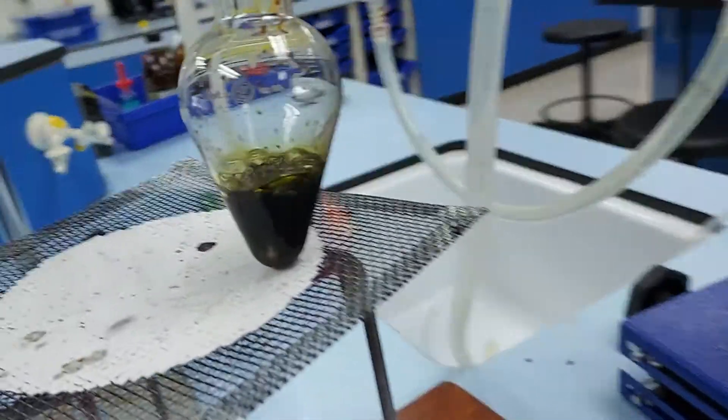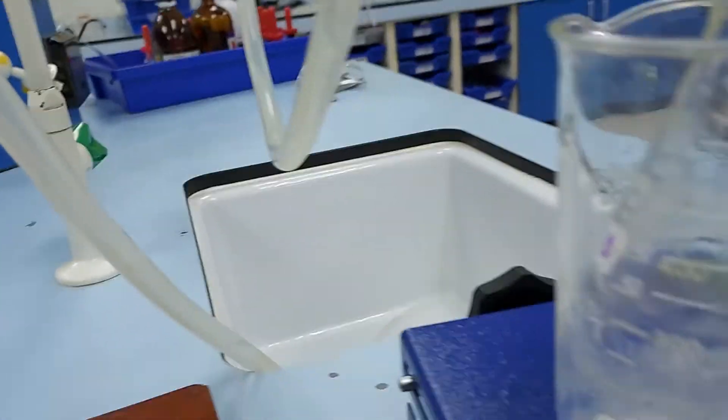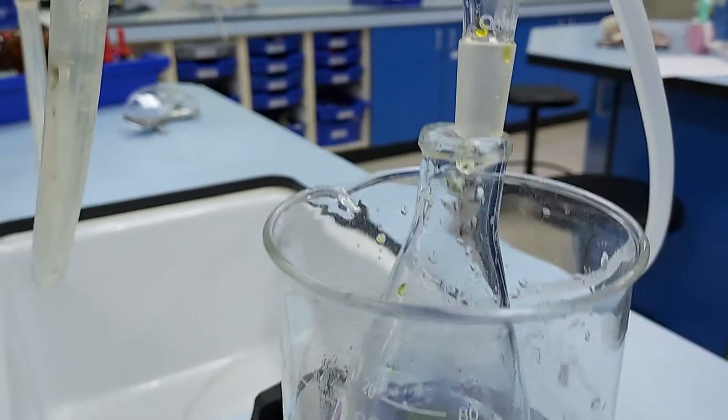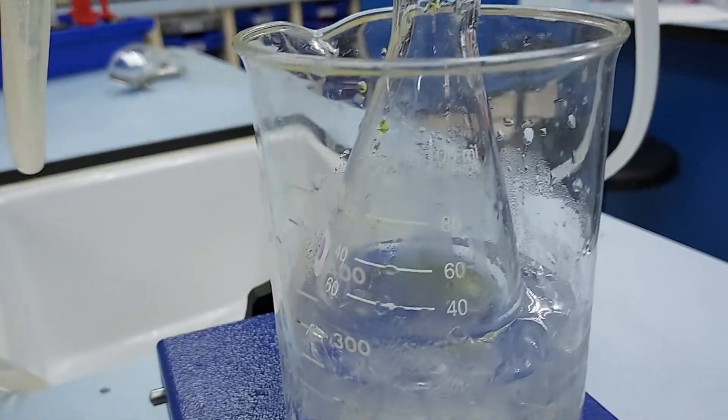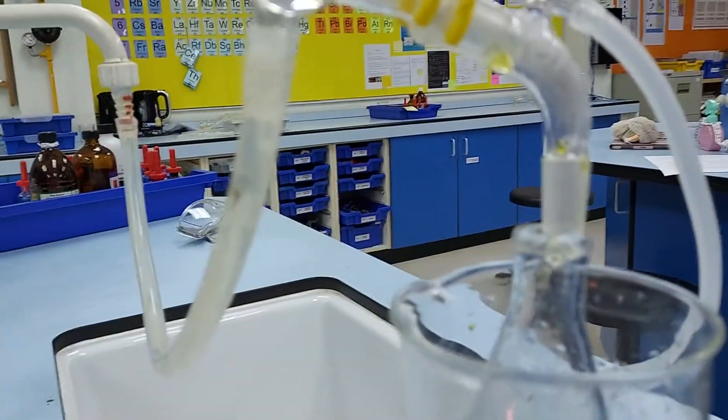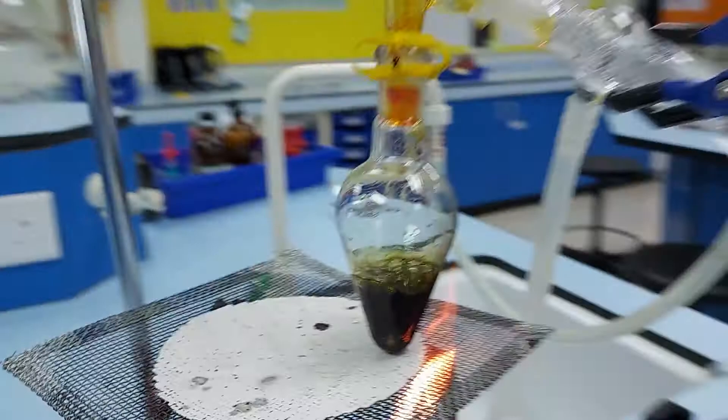The product distilled over into our receiving flask which is in ice water to condense it. We then took a few drops of that and tested it.